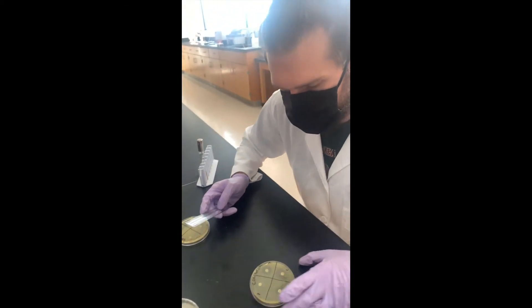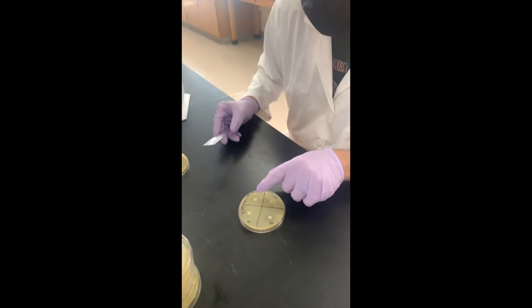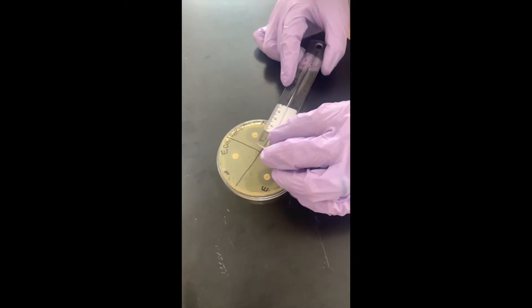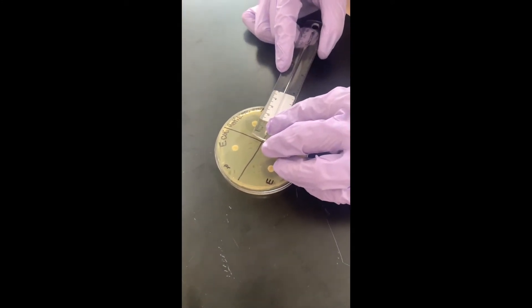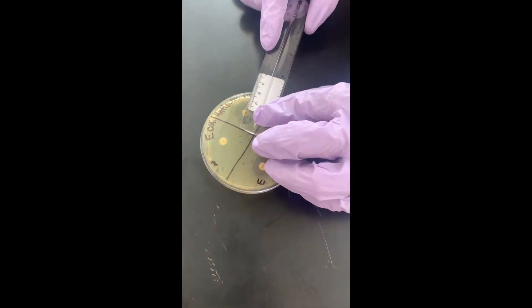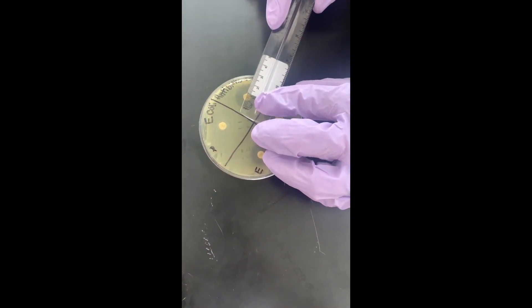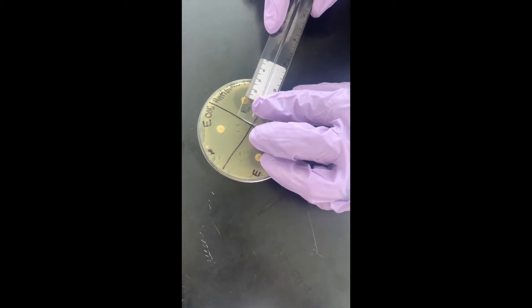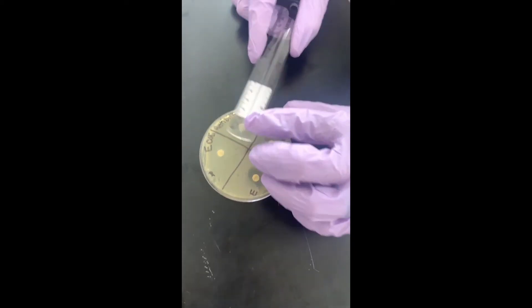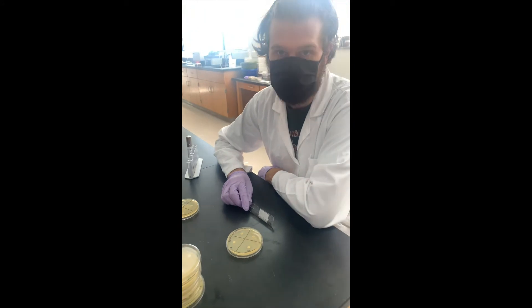Here we see an E. coli plate with a couple of antibiotic discs. We'll use this one here, tetracycline, as an example. I'll take the ruler and line it up so that I'm measuring the whole diameter of this zone of inhibition. That's about 23 millimeters, so tetracycline gives a 23 millimeter zone of inhibition.